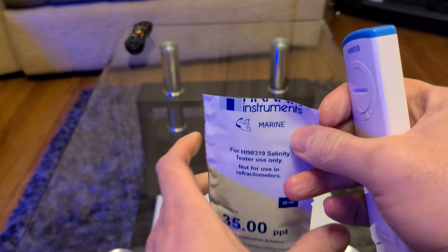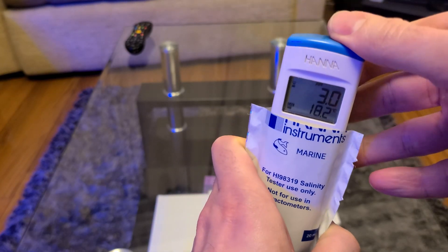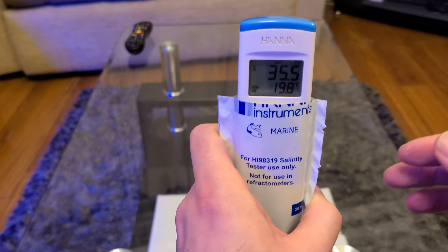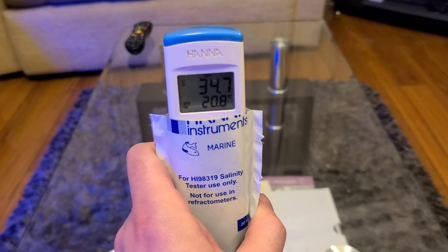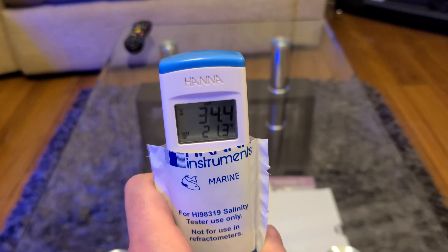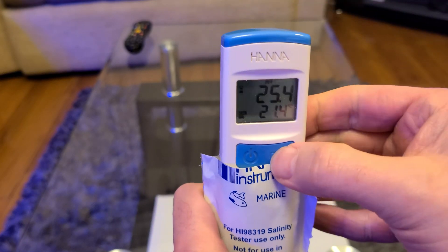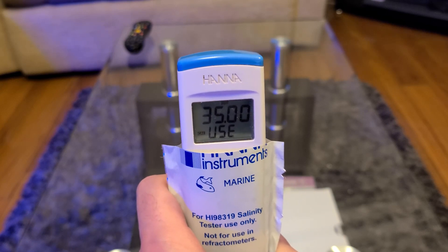Many hours later. So now I'll just show you the actual calibration procedure itself. What you need to do is wait until the device settles — it takes a few seconds, and you don't want to actually press that calibration button until you're sure it's not going to move any further. Once you're happy, go ahead and press that calibration button. It'll take a few seconds to actually calibrate the device and store the results.